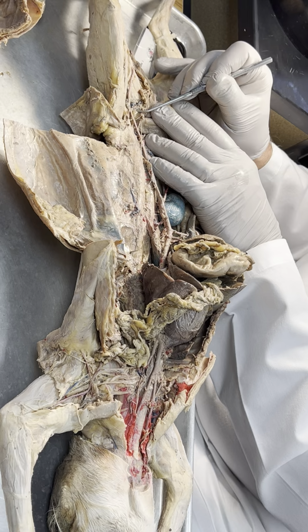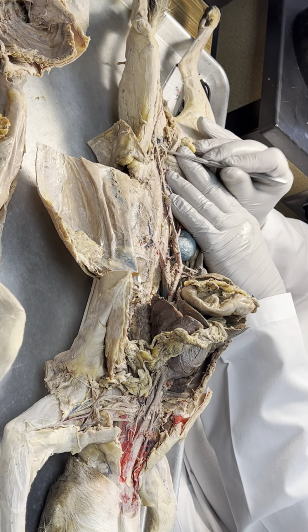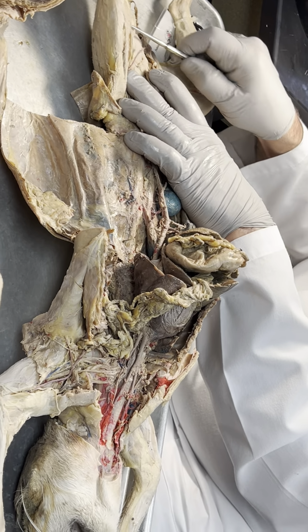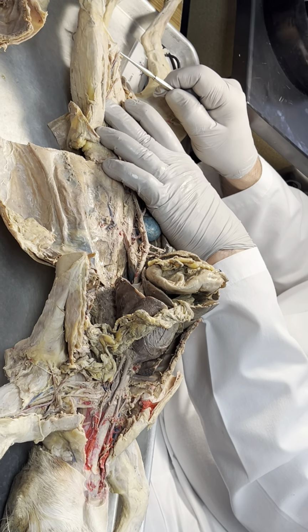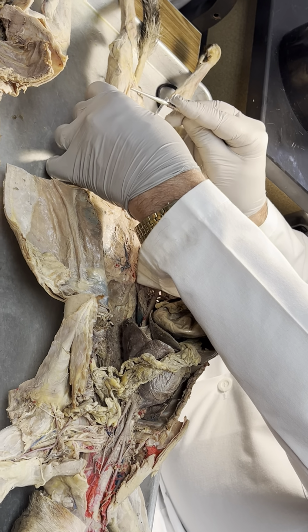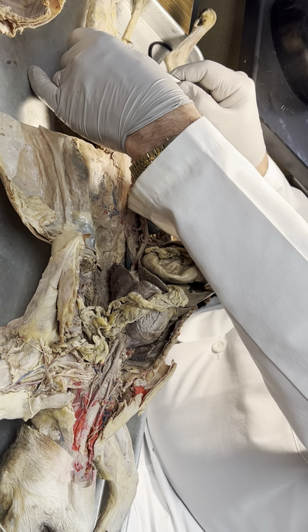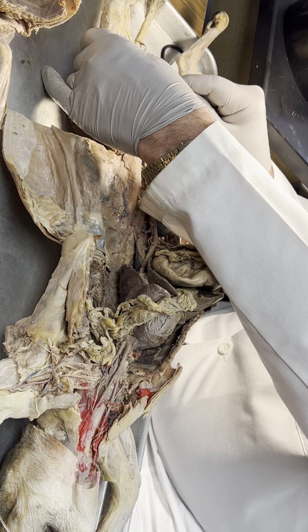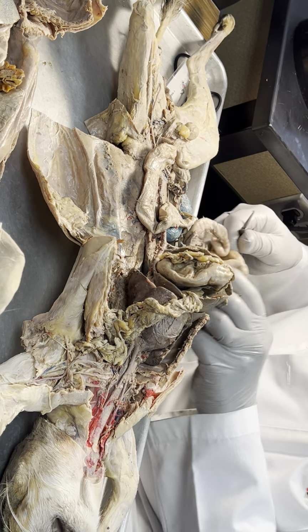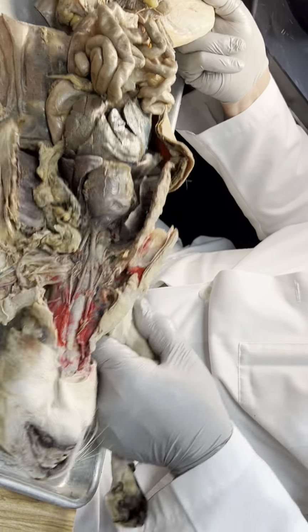External iliac coming out this way. That is the deep femoral. There's a broken femoral, but this is saphenous. The superior geniculate is broken, but there is the popliteal. Actually, popliteal's broken too, isn't it? But you can see it down in there too. And this side's not done at all. So this cat's done. We gotta have inferior mesenteric on this last cat.